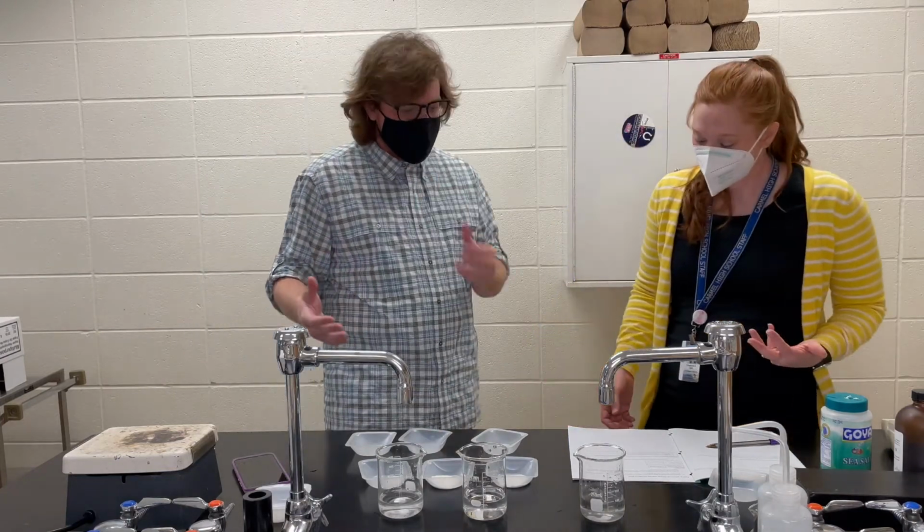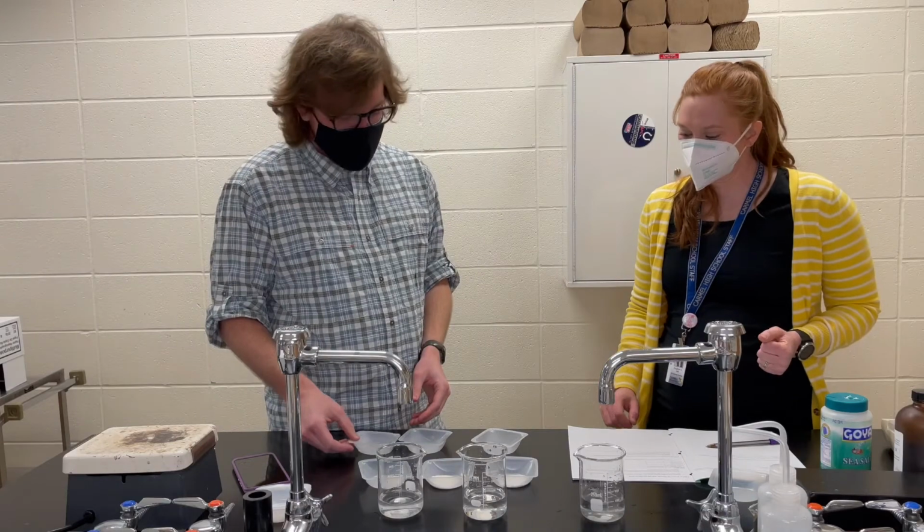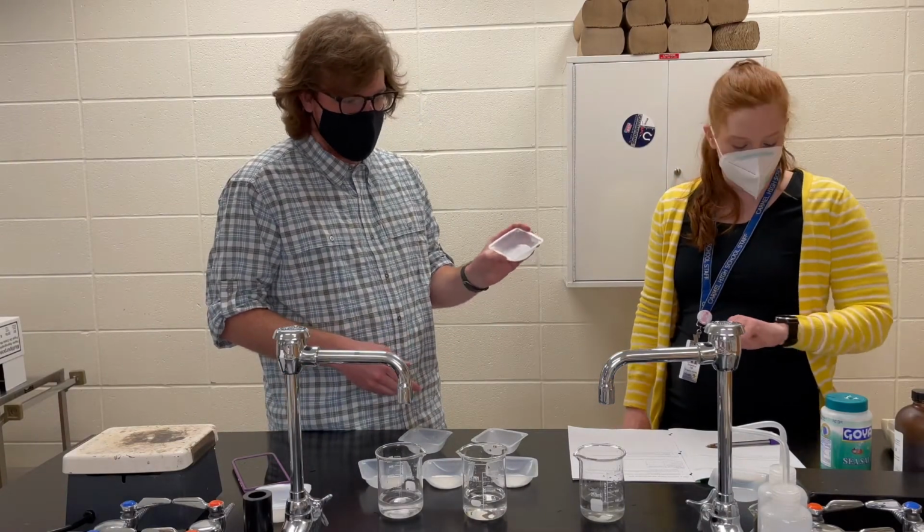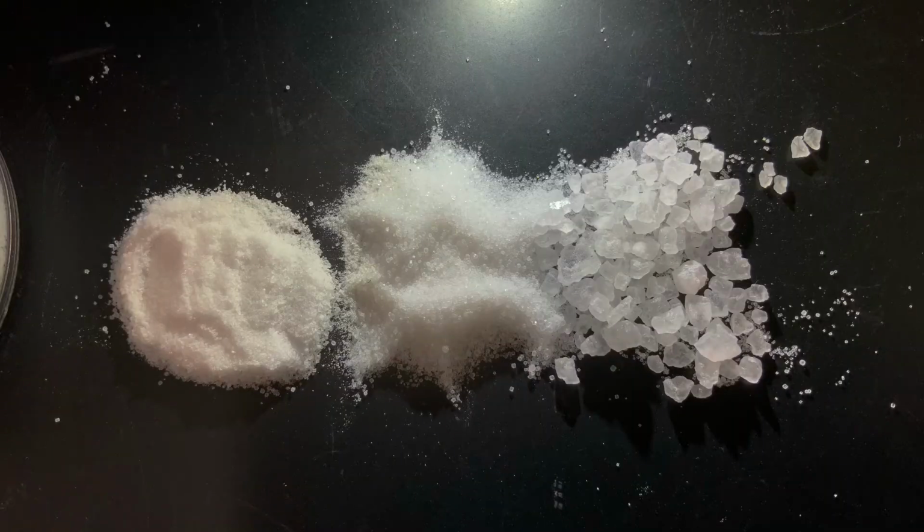What we're gonna do here is we're gonna take our 3 different sized salt granules and we're gonna see how each of them dissolve. So we've got our very small, finely powdered salt. Super small. We've got our normal grain that we've been using for all of the others. Probably like what you would use as table salt. And then we got some chunky salt, some larger crystals that are a lot more visible to the naked eye.